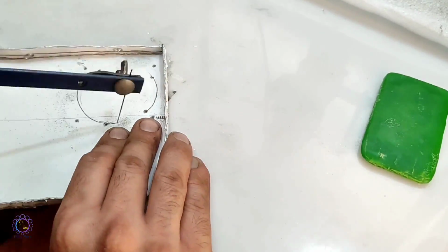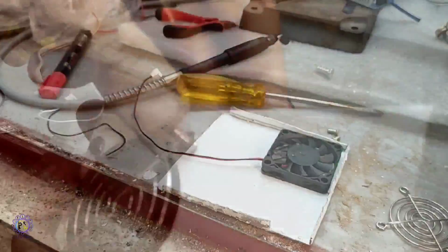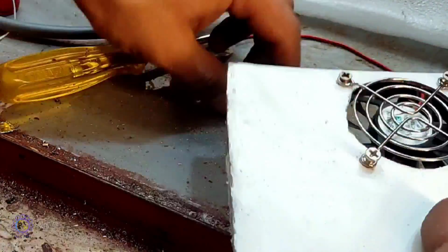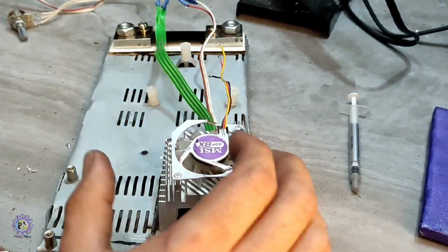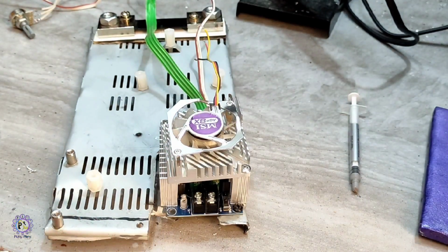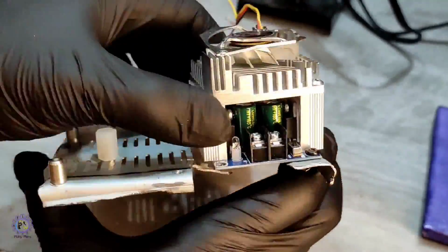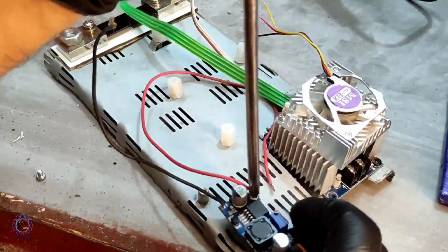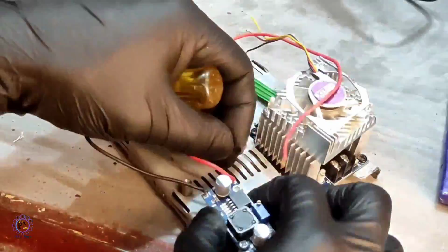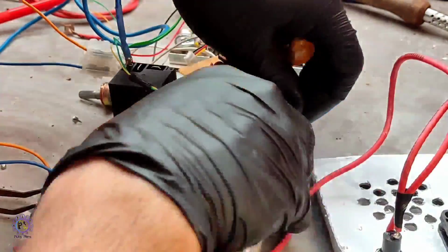Afterward, the fan place was cut and the fan was tightened in place. Then I placed a dedicated cooling fan on the main buck converter. And the second buck converter was added for the cooling fans and also short circuit protection. And the short circuit protection was added on the stand.